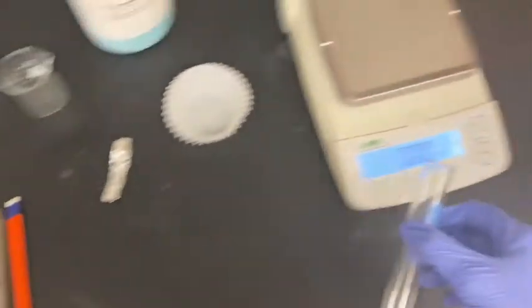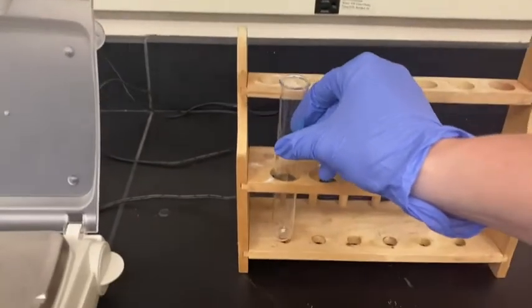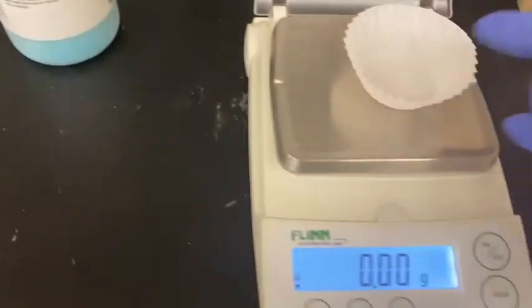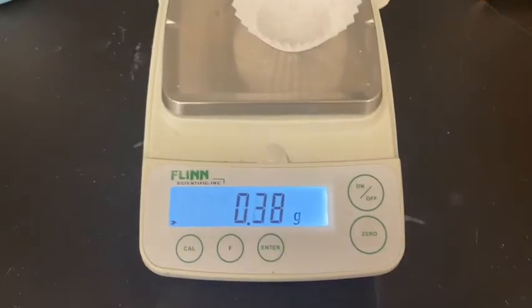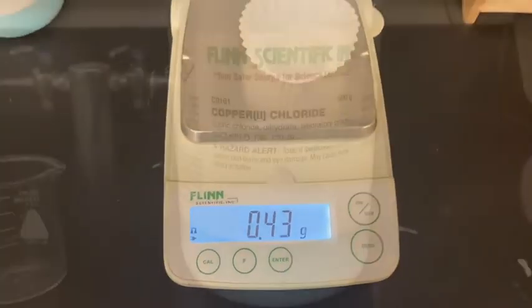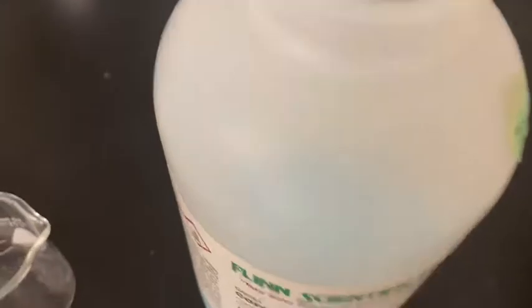Let me know if you have any questions. Enjoy. I've got my materials for my lab. I am putting my test tube into the test tube rack. I don't have any weighing trays right now, so I am using a cupcake liner. You can see the mass of it. Here is our copper chloride — take a better look.